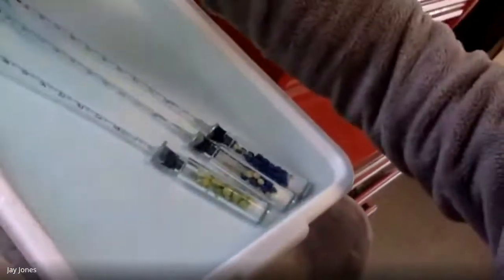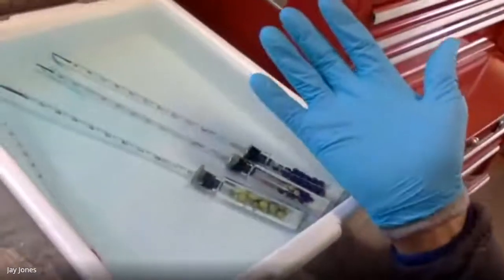I have it at 10C. I have a jug of warm water, and I have cold water down here. I have snow outside. See the snow? I've got snow outside if I need to cool it down even, and a freezer. Fantastic, right? However, it's 10C, right?